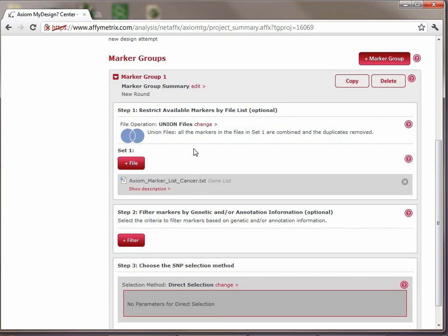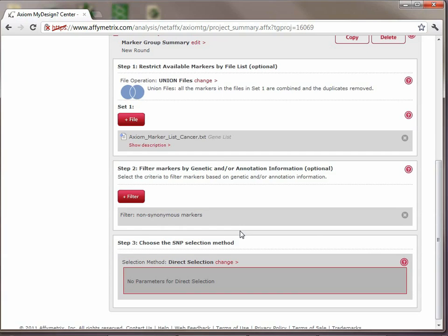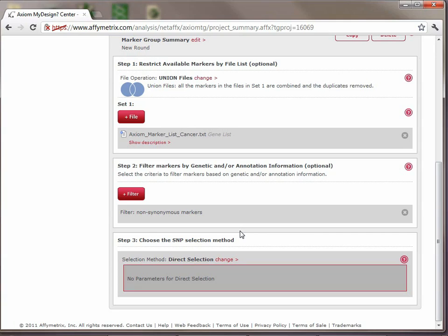So now we have marker group 1. We know that we're interested in the cancer genes. So the next piece about that is we were interested specifically in the non-synonymous ones and the ones with a low minor allele frequency. So we can go to the filter section, and we will browse for adding the filter for non-synonymous markers. Now what's important to know is that if you try and add multiple filters within the same group, they will be combined with an AND, which means that if we added at this time the low minor allele frequency also, we would be searching for non-synonymous markers with a low minor allele frequency in Caucasian, which isn't what we want. We want all non-synonymous markers, and we want all markers with low minor allele frequency in Caucasian. So this indicates right away that we're going to need to make a second marker group for ourselves.